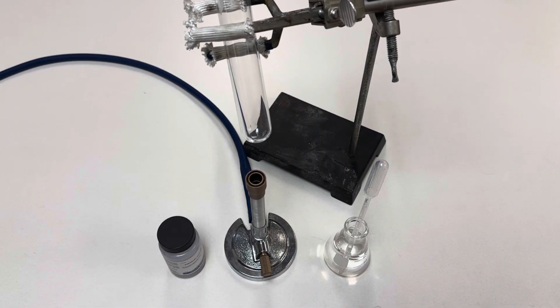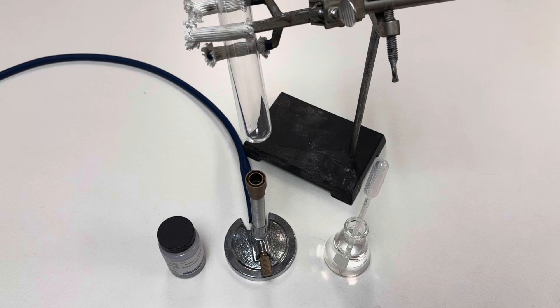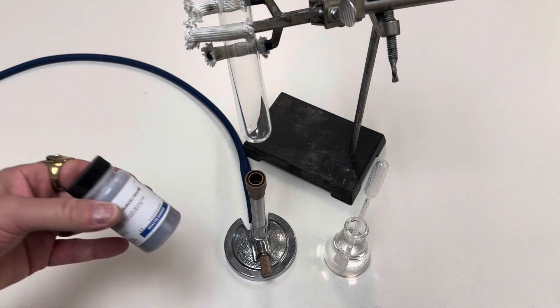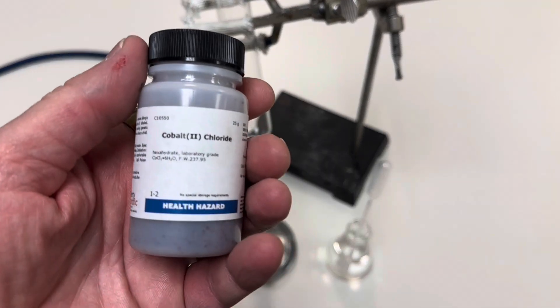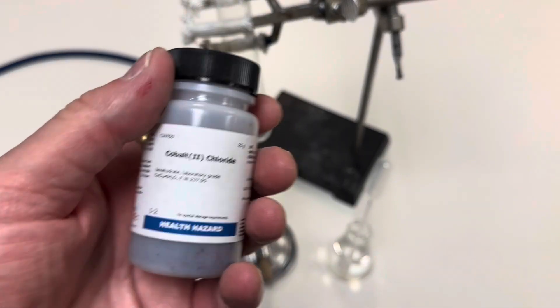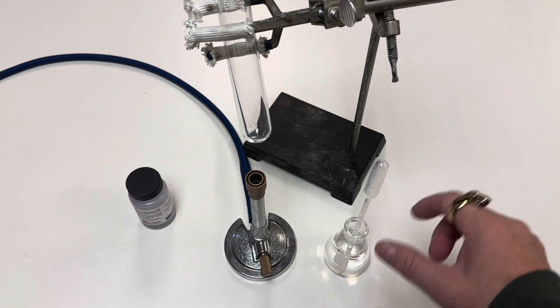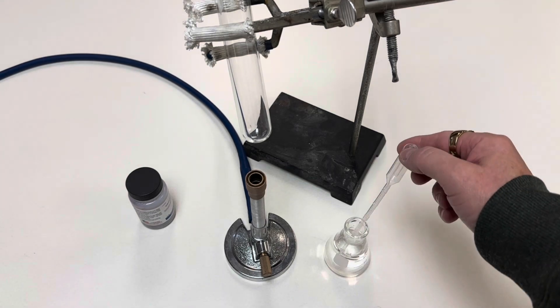All we're using in this demonstration is a test tube, a Bunsen burner, cobalt-2-chloride hexahydrate, and a little bit of distilled water and a dropper.